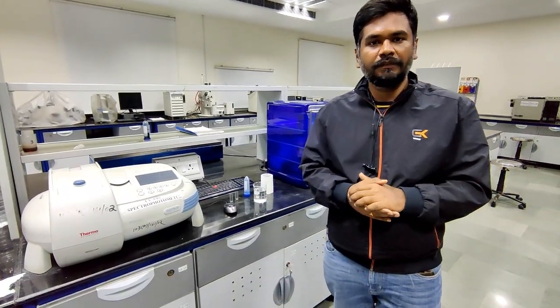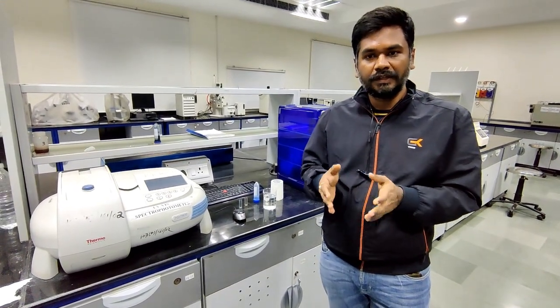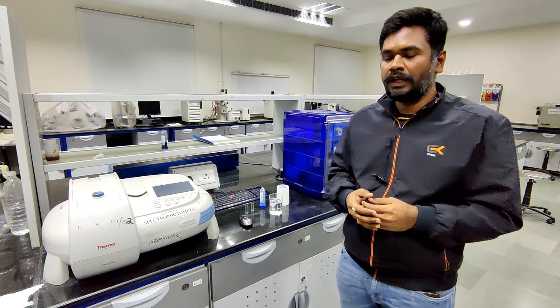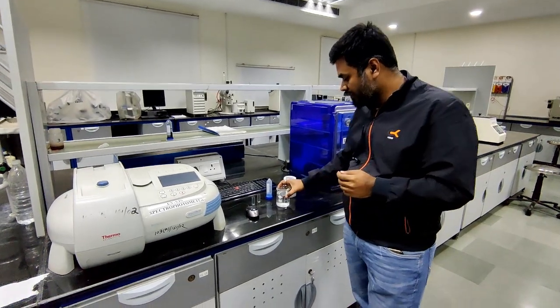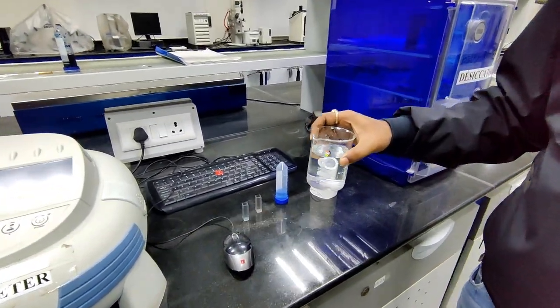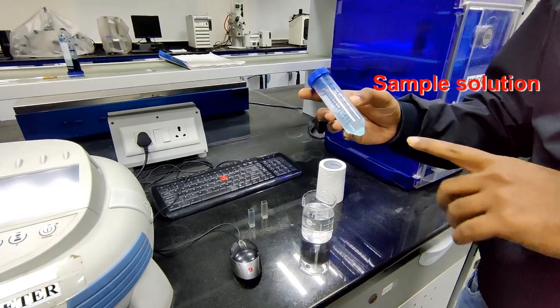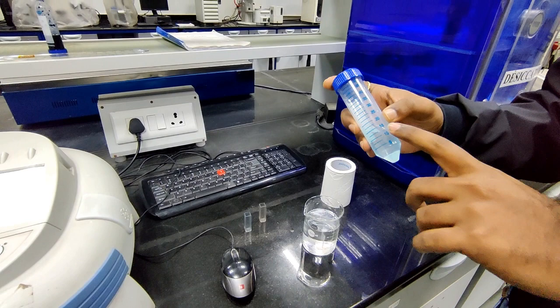Now I'll explain the measurement of the sample. Before going to measurement, first read the manual carefully. In that we have given a systematic procedure of the experiment, how we are going to conduct it, and to run the experiment we require these things. In this process I'm using distilled water as a solvent, and I have weighed the sample, dispersed it in the distilled water, and prepared the sample.